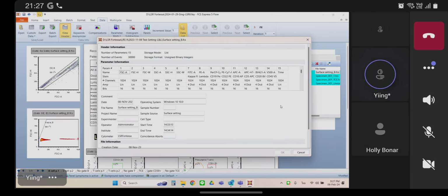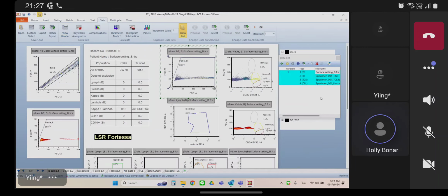The template parameter is the same, right? The number of parameters is not the same. Can you explain it to me again, please? Okay, so let's cancel this. Go back to the one that works so we can look at it again.